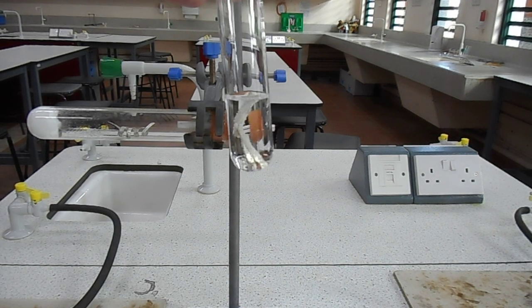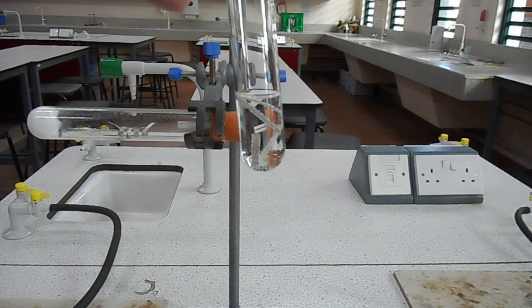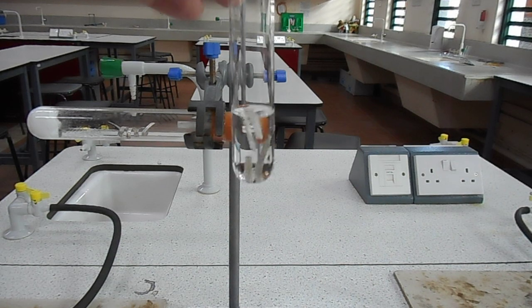This is magnesium in water. You should be able to detect some bubbles on the outside. It reacts quite slowly.